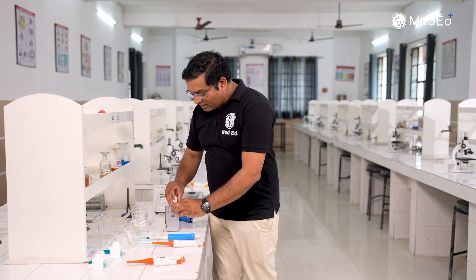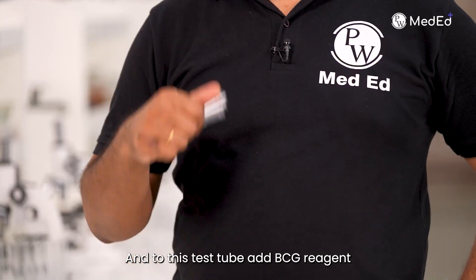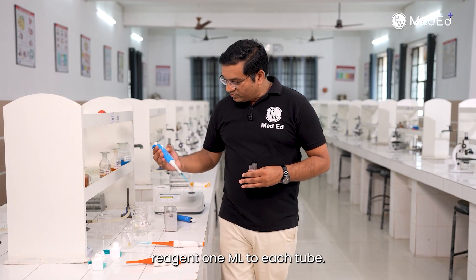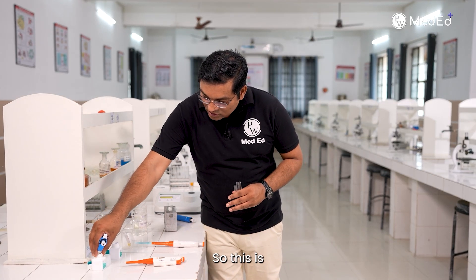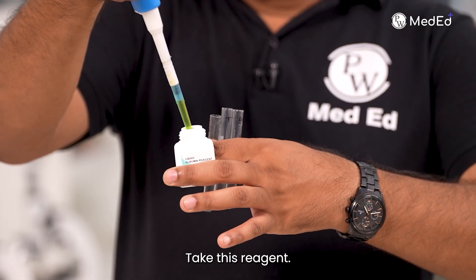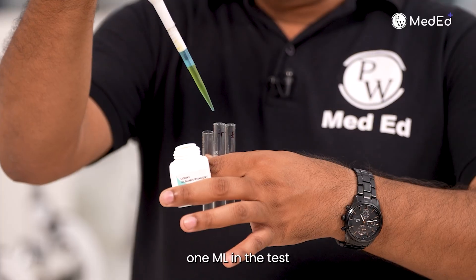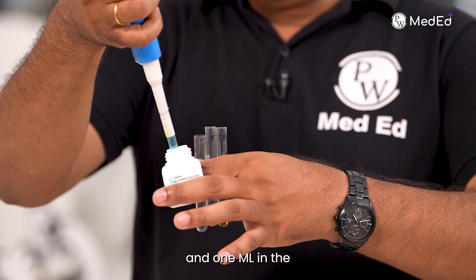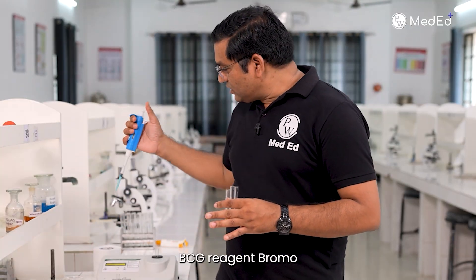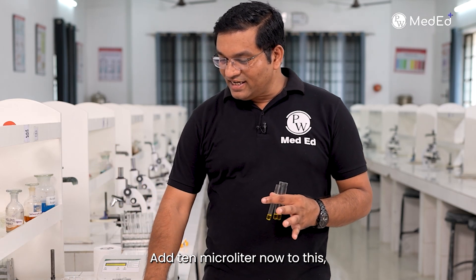Now for albumin estimation: take 3 test tubes as test, standard, and blank, and add BCG reagent — bromocresol green reagent — 1 ml to each tube. This is the albumin reagent, also known as BCG reagent. Add 1 ml in blank, 1 ml in test, and 1 ml in the standard tube. To this BCG reagent — bromocresol green anionic dye — add 10 microlitres.